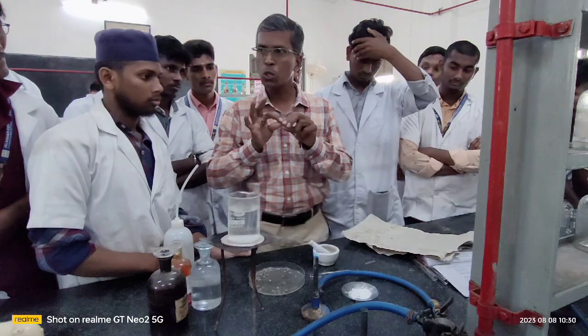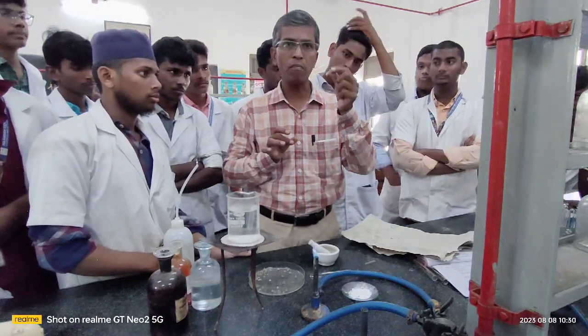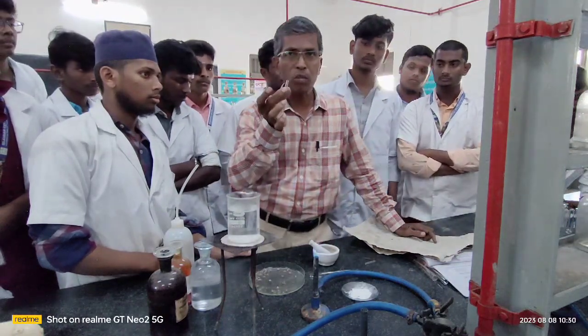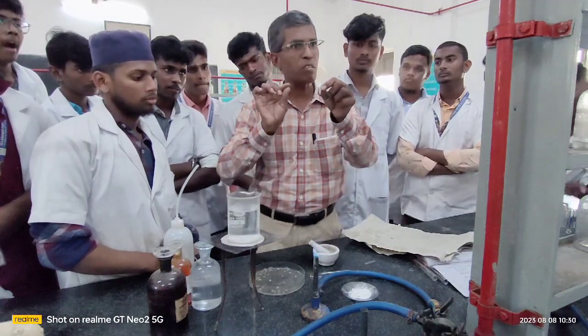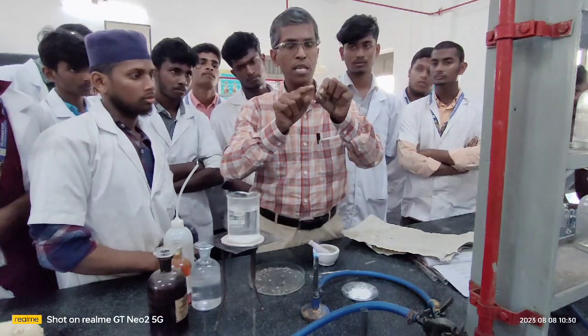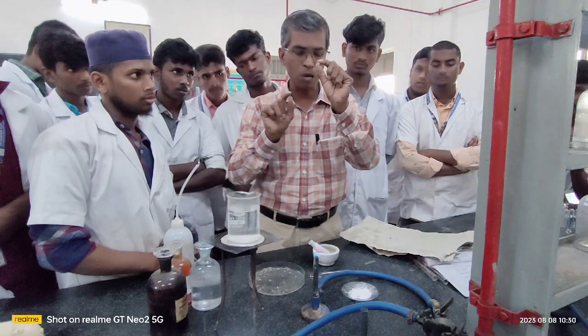Now, to prepare the sodium fusion extract, you take a fusion tube. This is called the fusion tube. No need to introduce the fusion tube, you are in the 3rd class this semester. One end of the fusion tube is open and the other end is closed.